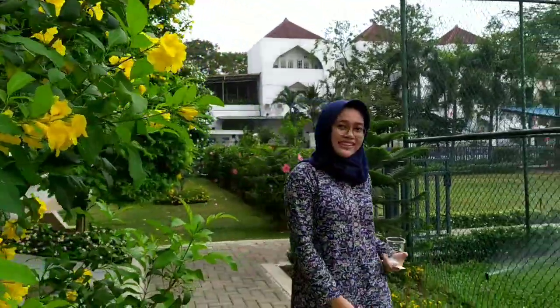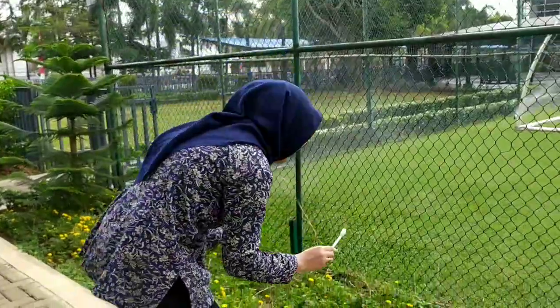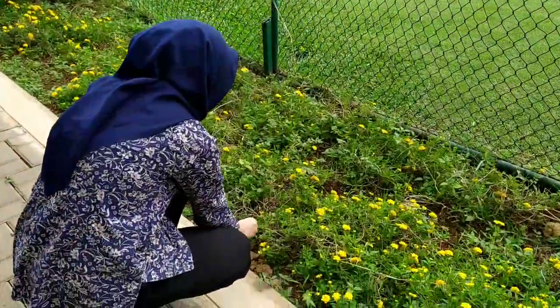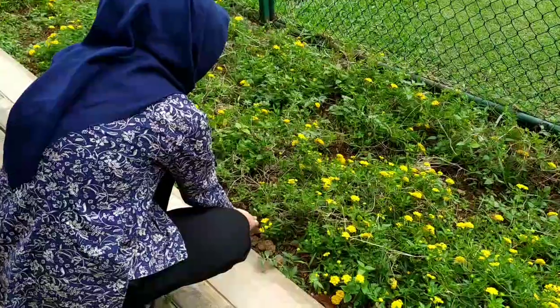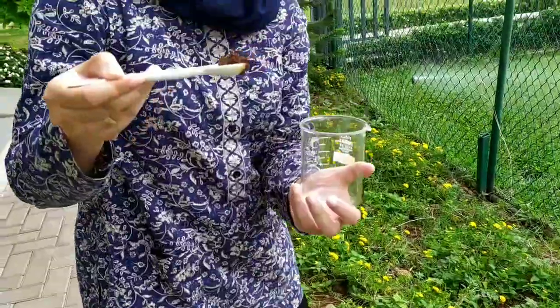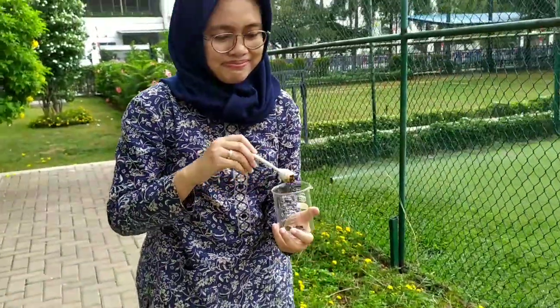Now we will take one spoon of soil here. And this is enough for today's science experiment.